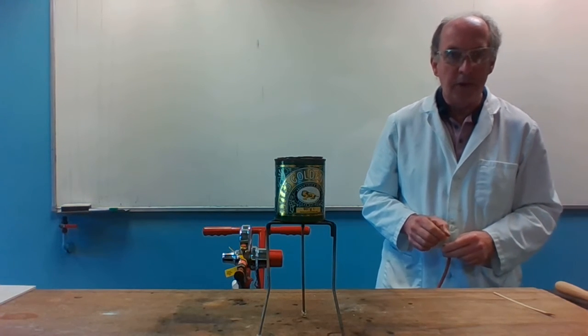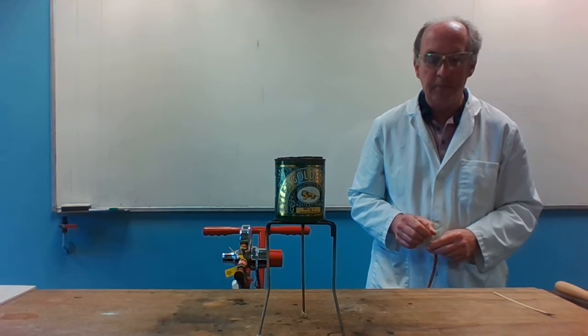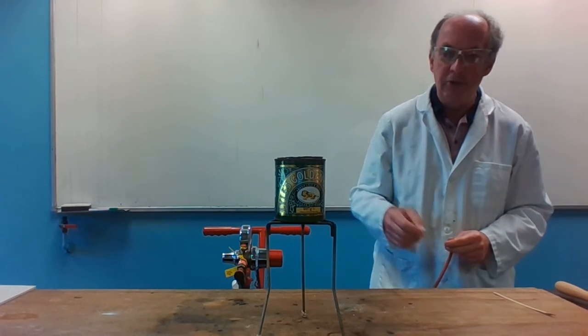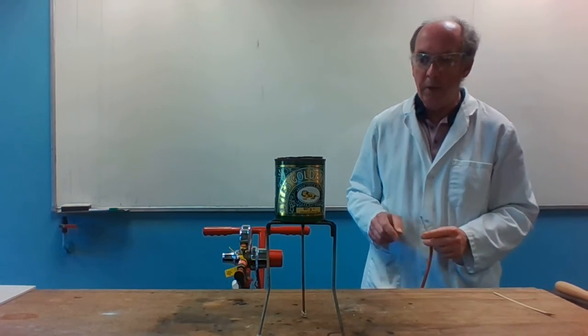Here is a second experiment to demonstrate the combustion of hydrogen. This time we have a syrup tin which has a hole in its lid and a hole in the bottom.